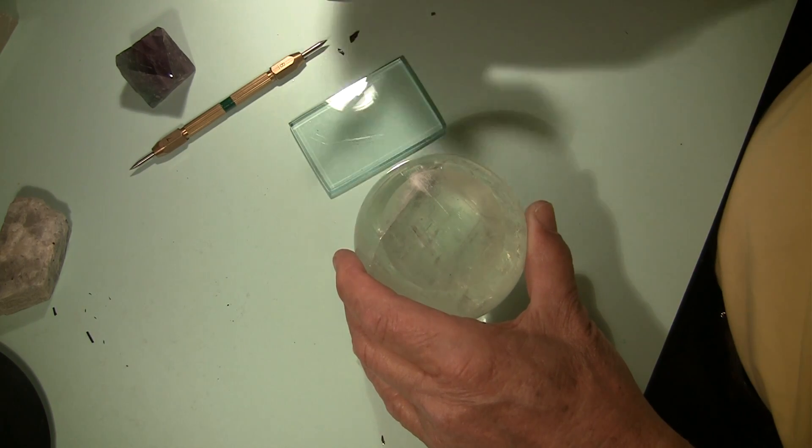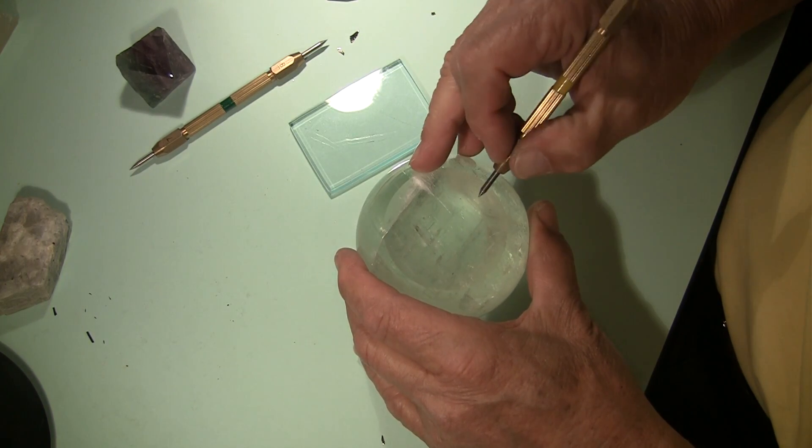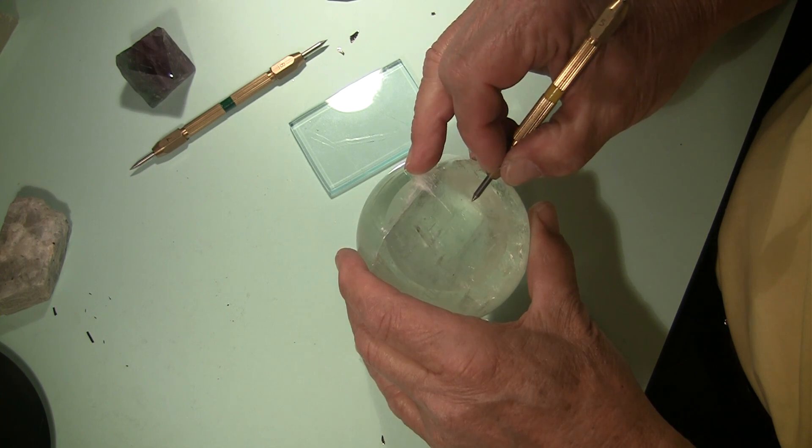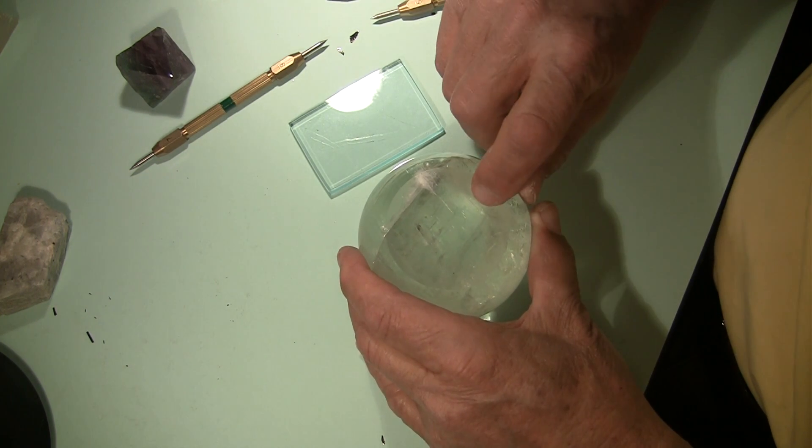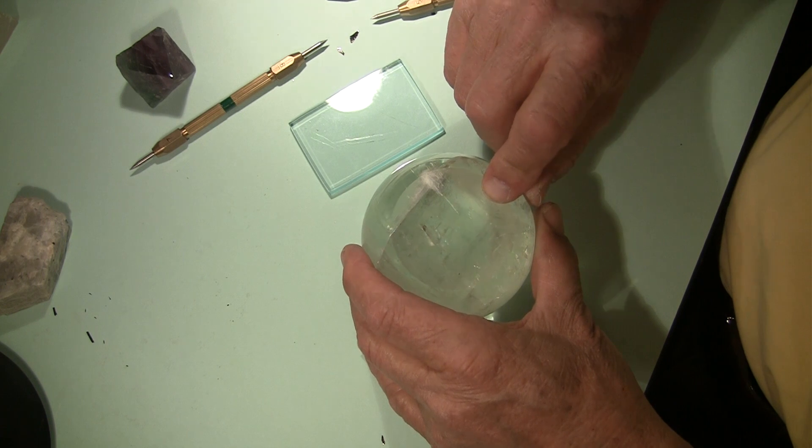We'll use the hardness points. Let's go down to number 4, see if it scratches it. Definitely left a scratch right there. This mineral has a hardness of less than 4.